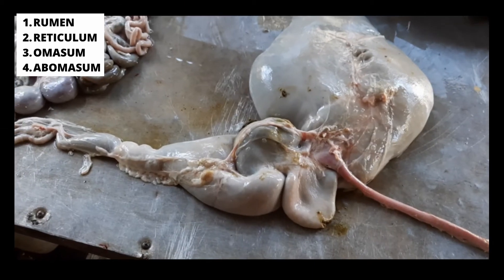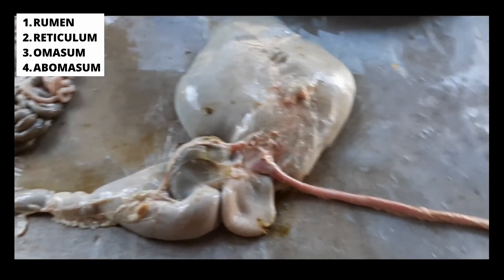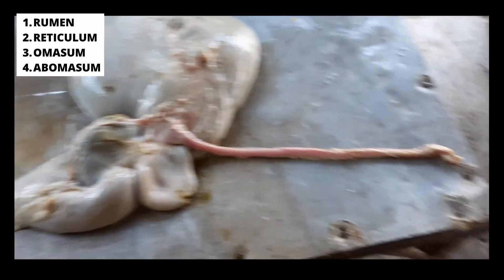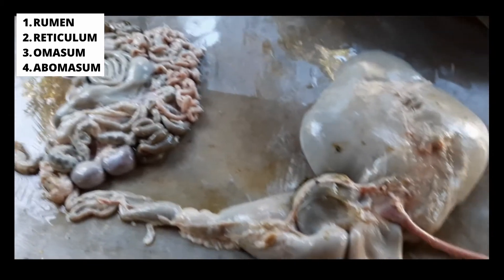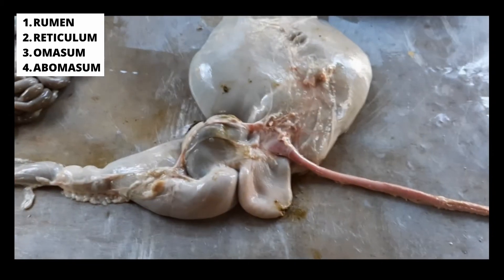Alright guys, what I'm basically going to show you now is the digestive system of the goat, which is a ruminant digestive system.